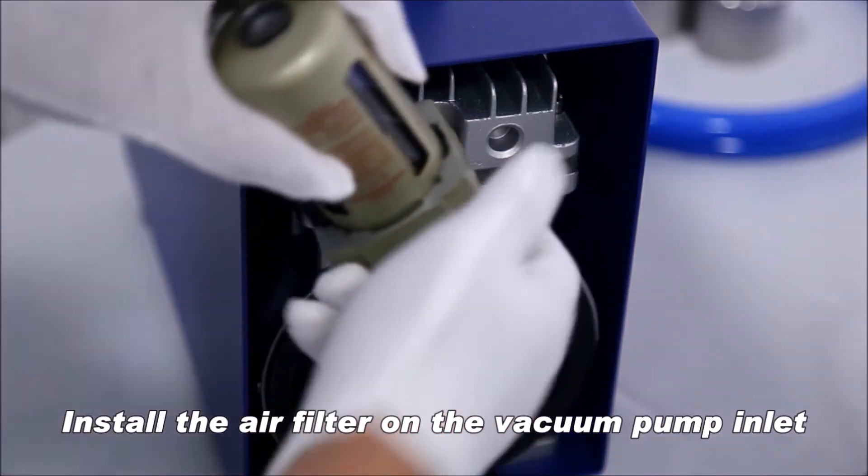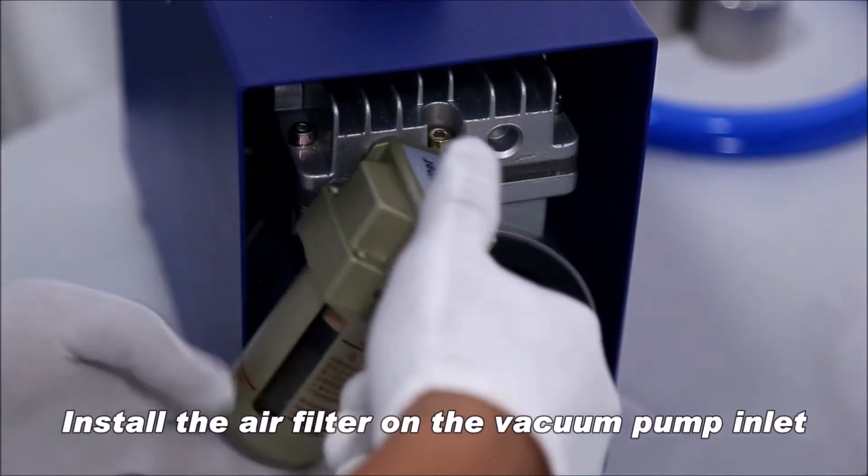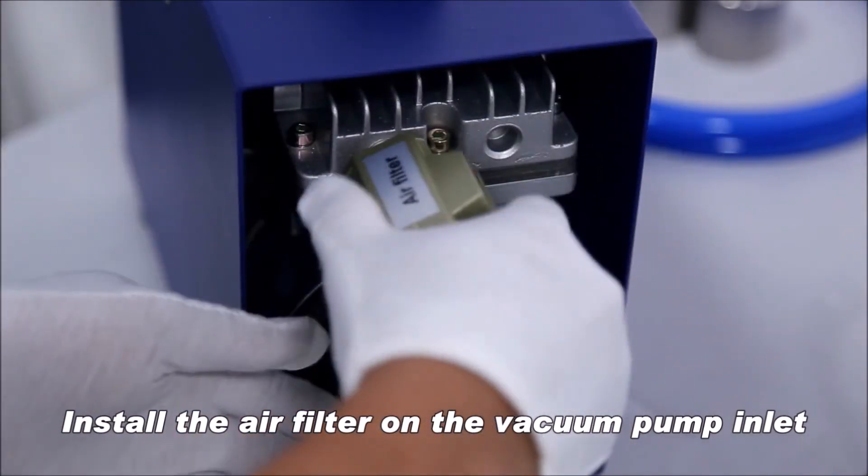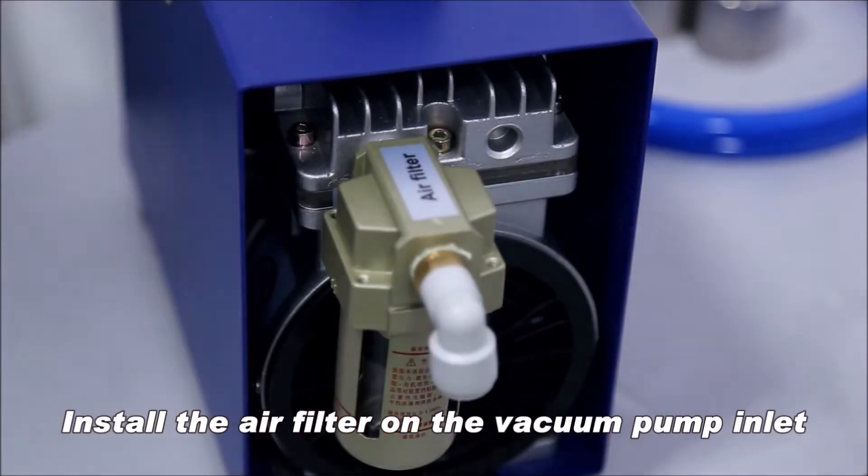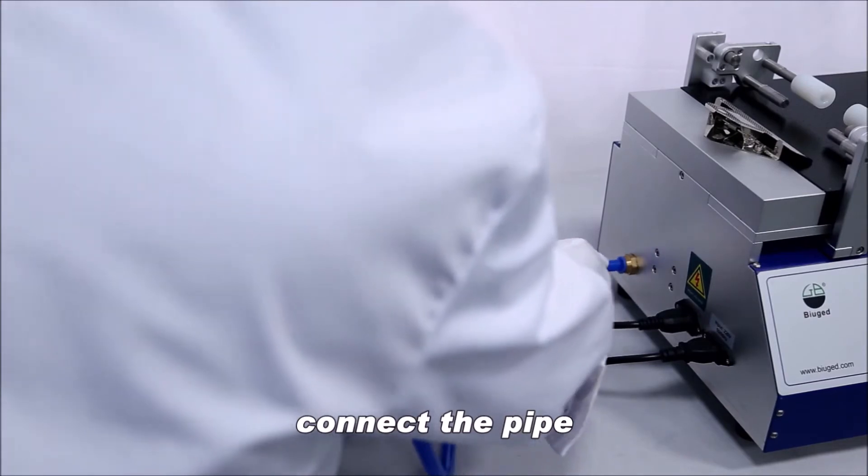Install the air filter on the vacuum pump inlet. Connect the pipe.